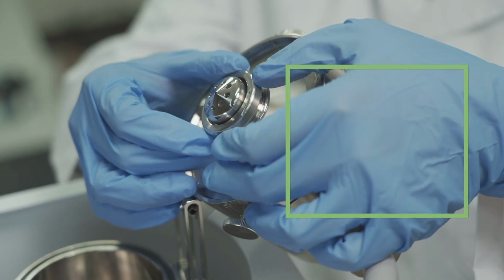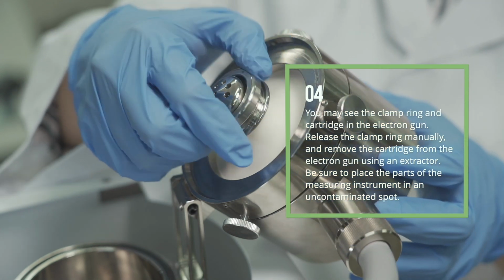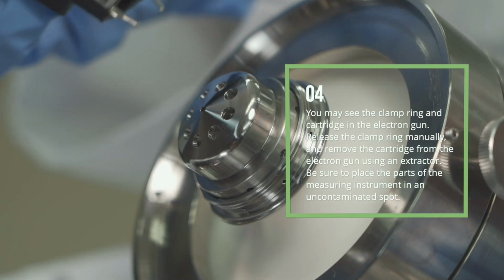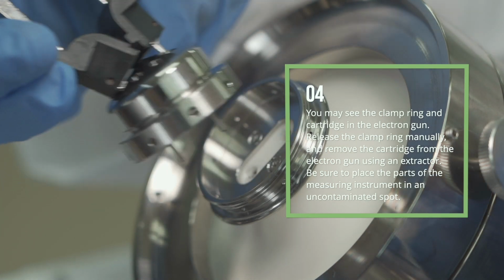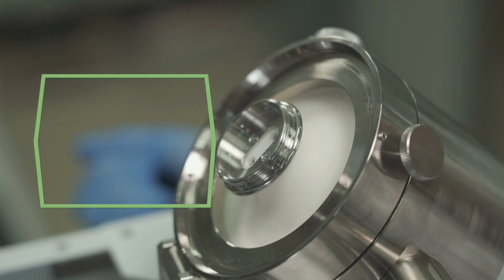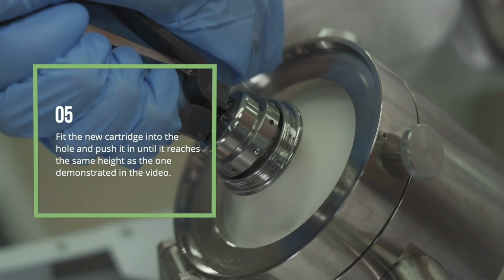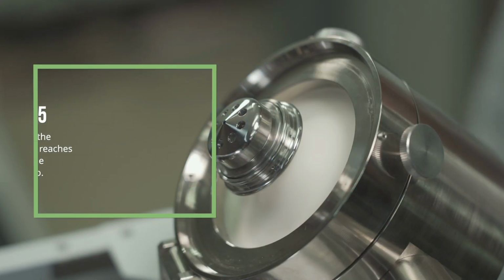4. You may see the clamp ring and cartridge in the electron gun. Release the clamp ring manually and remove the cartridge from the electron gun using an extractor. Be sure to place the parts of the measuring instrument in an uncontaminated spot. 5. Fit the new cartridge into the hole and push it in until it reaches the same height as the one demonstrated in the video.